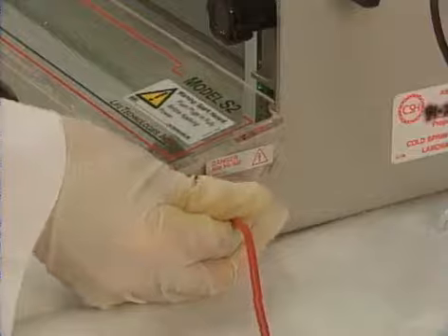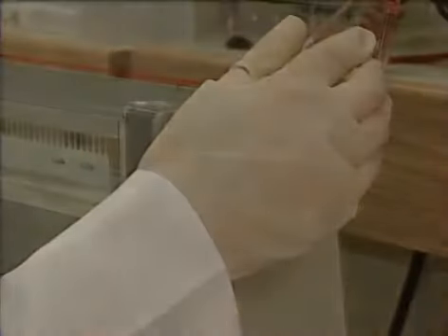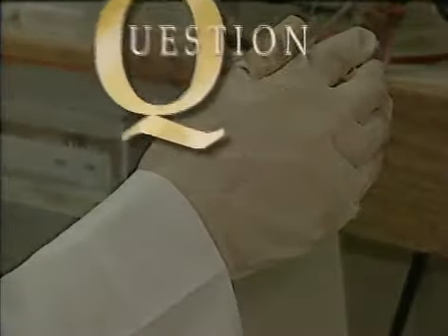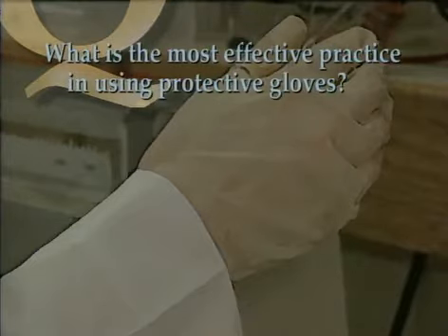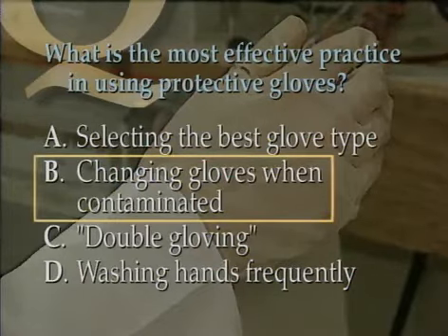Now Anne is ready to take her gel down. Of course, she'll put on gloves before reaching into the bath. What's the most effective practice in using protective gloves? Surprisingly, the answer is B. The most effective practice is to change gloves frequently and when contaminated, because all gloves are permeable to some degree.